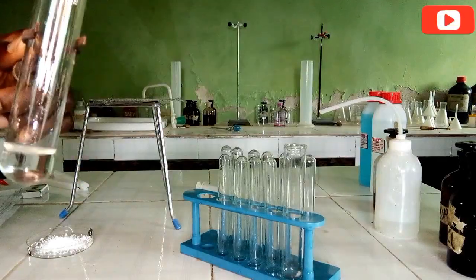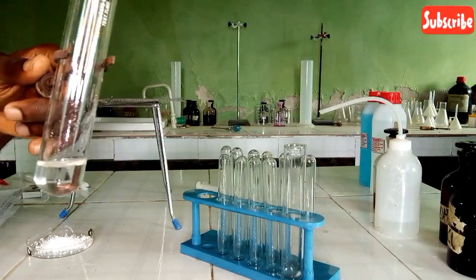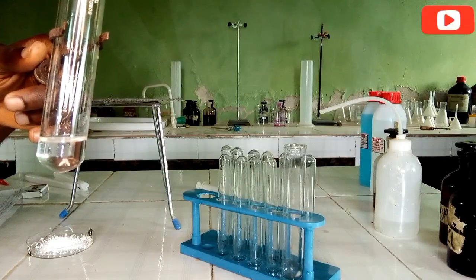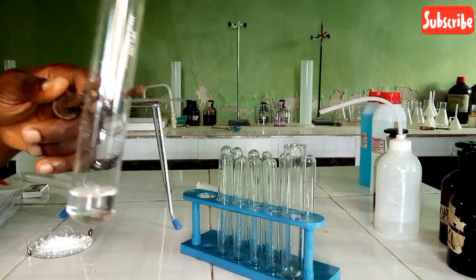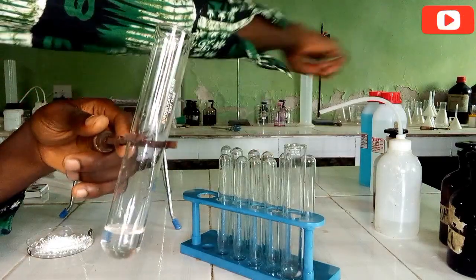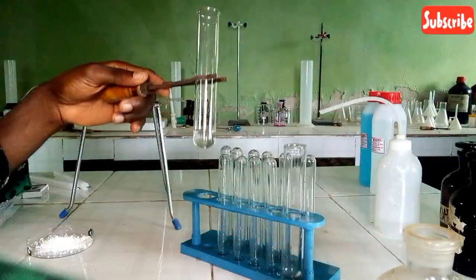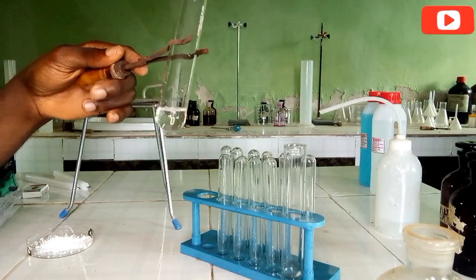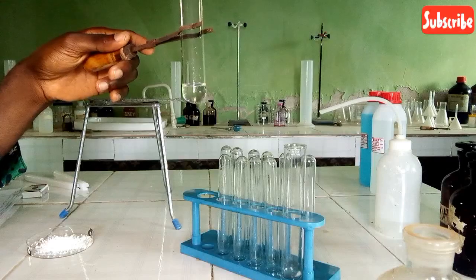Then what next? Aqueous solution of C, which is this solution. We will now add potassium heptaoxodichromate(VI) to it. So we'll see the changes that will take place after adding that. So this is K2Cr2O7. I will add it into it, but I can actually divide this portion into two so that I can make another portion when it is time for me to do the other test.